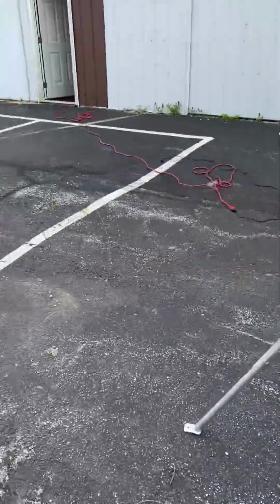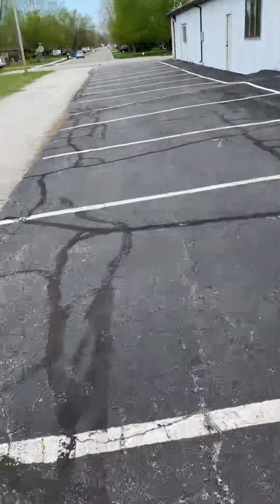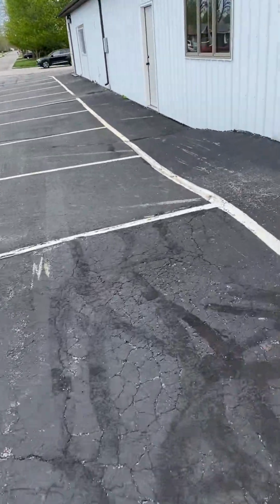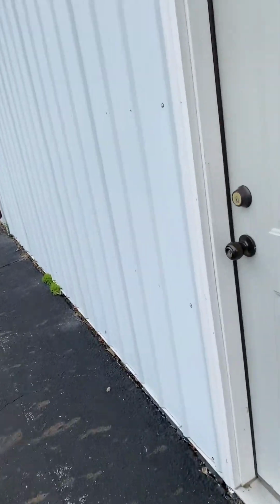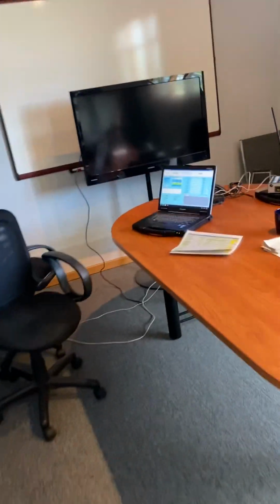Now let's go back, and we're going to walk our way back to the office, and we're going to take a look at how that system is, what the chemicals are, and the concentrations on the computer. Go back through the door here. And again, AccuSense is taking a sample every 3 minutes and then reporting that back to the PC here. So you're always getting a sample, continuous monitoring.